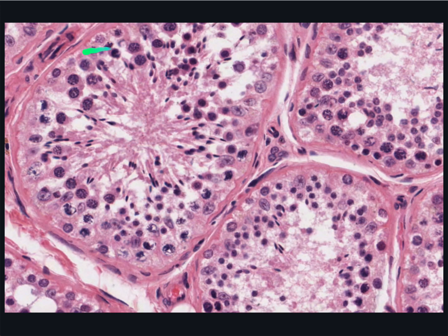You can see in this image at least 3 seminiferous tubules, sectioned with interstitial space in between. This is where Leydig cells or interstitial cells of the testis will be located, but they're difficult to see in hematoxylin and eosin sections such as this one. The clear regions are areas of artefact due to tissue shrinkage.